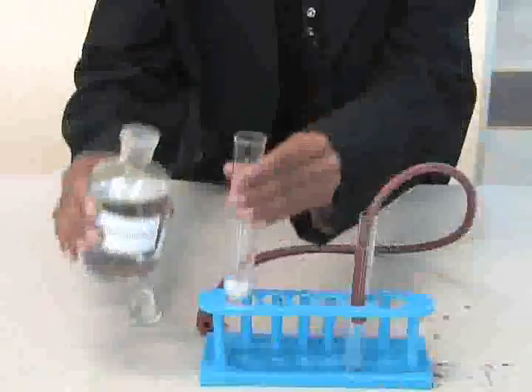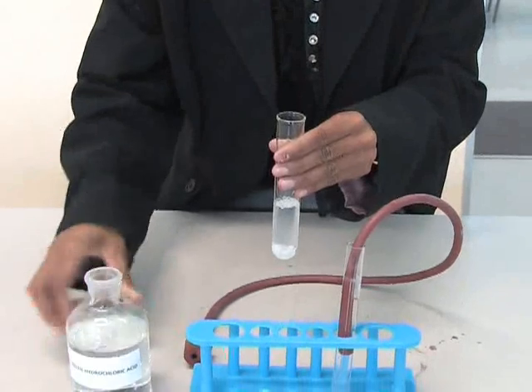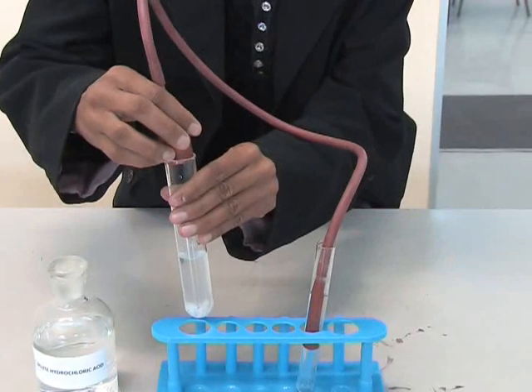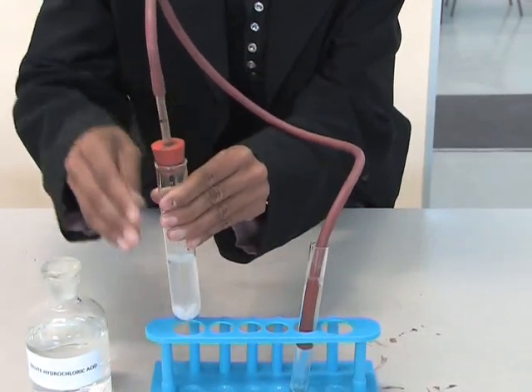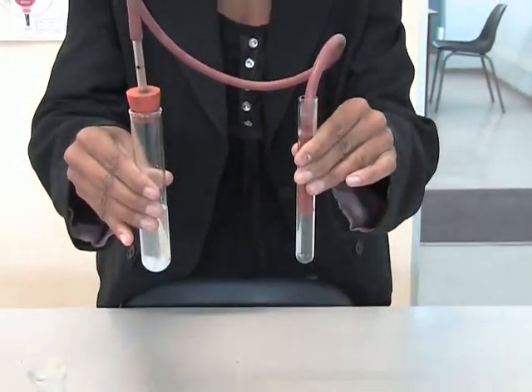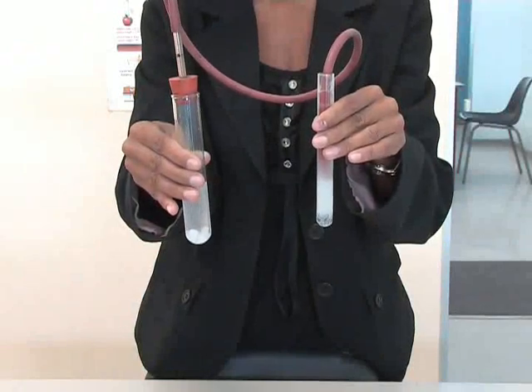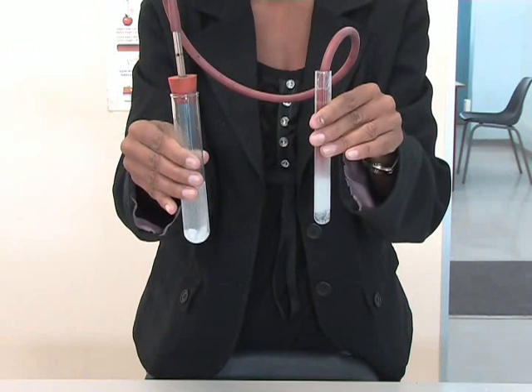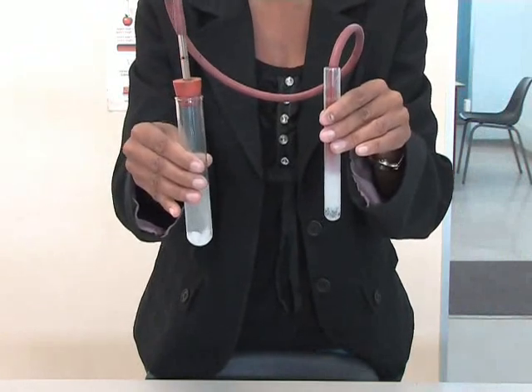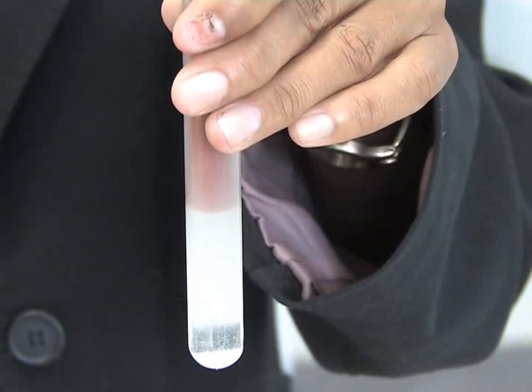I am going to add some hydrochloric acid to the unknown solid in the test tube. Look, the lime water has turned milky. Does that mean the white solid is carbonate? Yes, this test confirms that the solid does contain a carbonate.